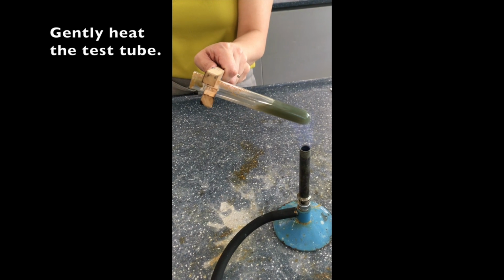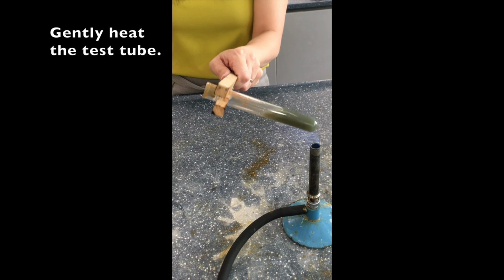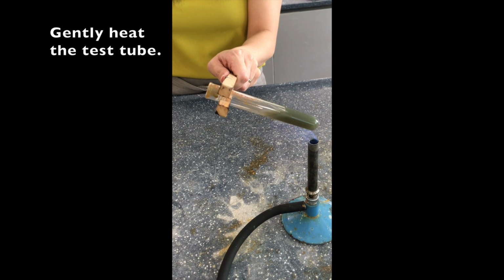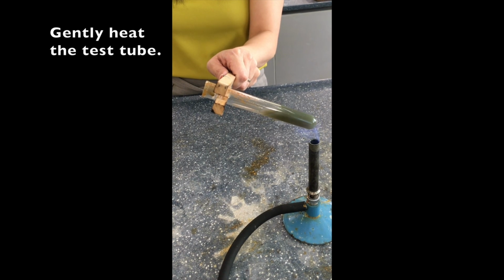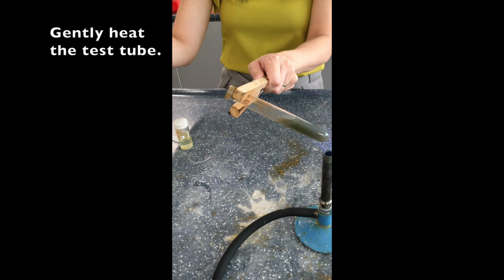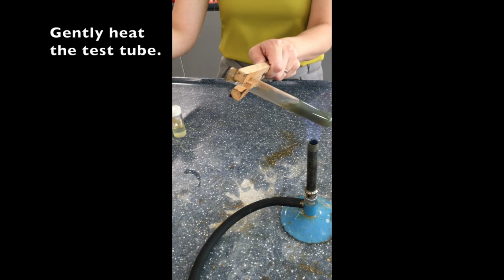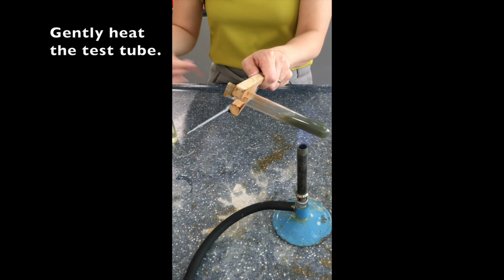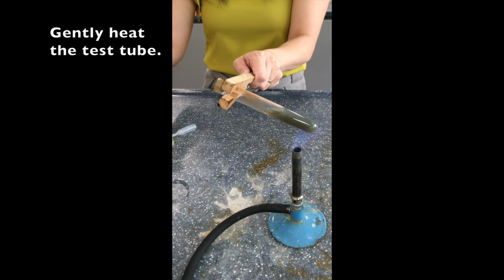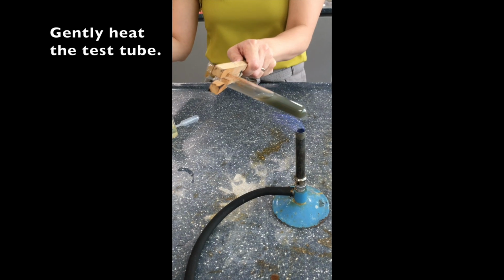And take note, every time we are testing for a gas, we need to be patient, especially with ammonia gas, as it takes quite some time to change the color of the litmus paper, and you have to be very observant to see the change of the litmus paper, as the change may not be that obvious. So if you feel that it's starting to boil, you remove the test tube from the flame to prevent any splashing.